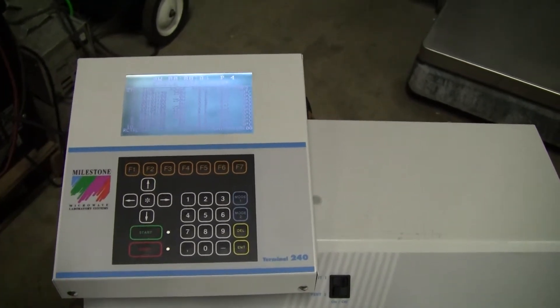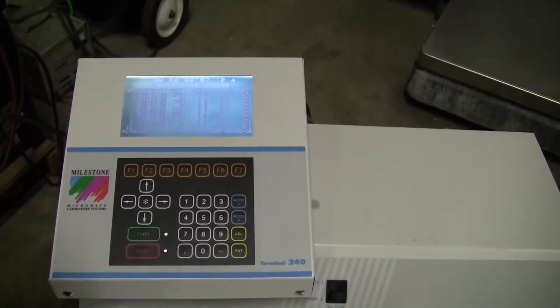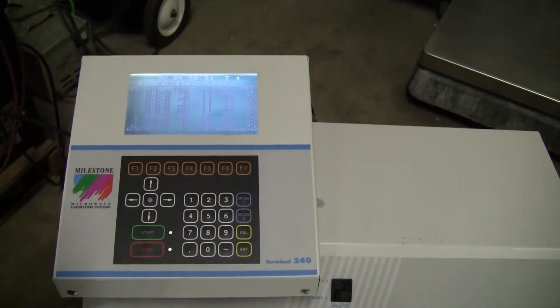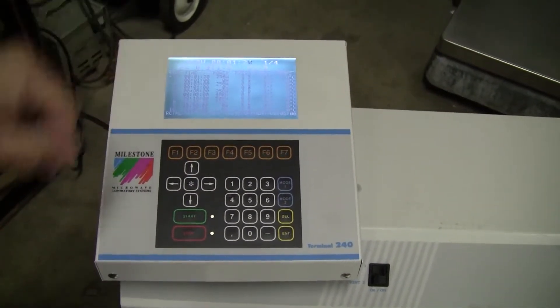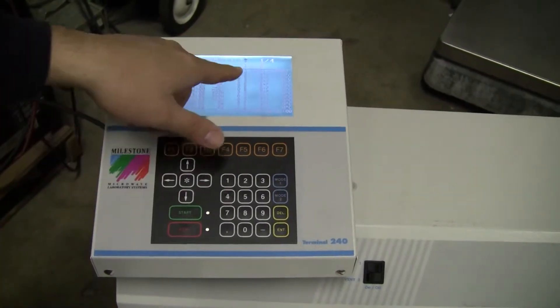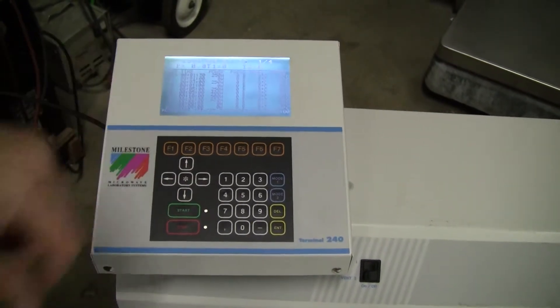When I do that, instrument seems to be coming on. 250 watts of energy for a minute 24, which is right on here in step 1.